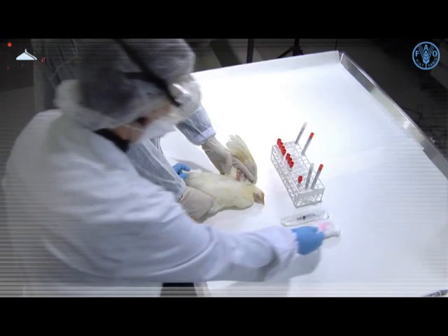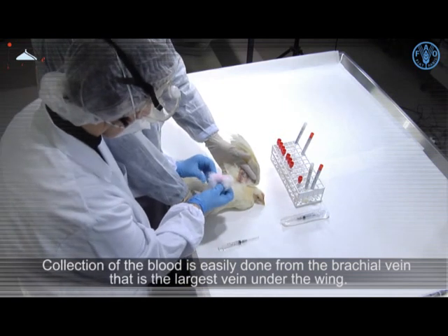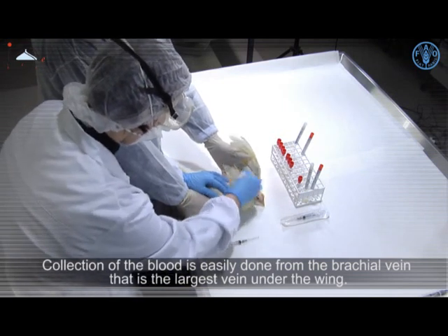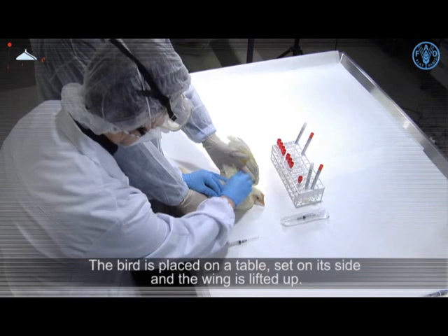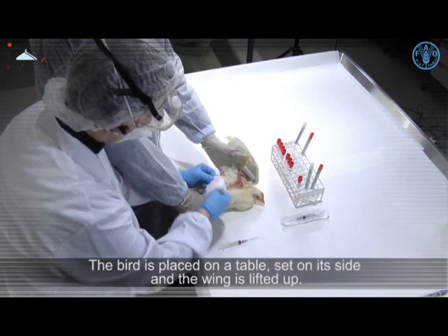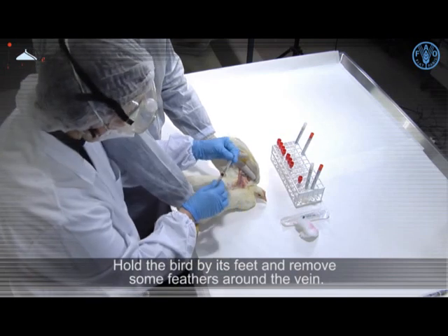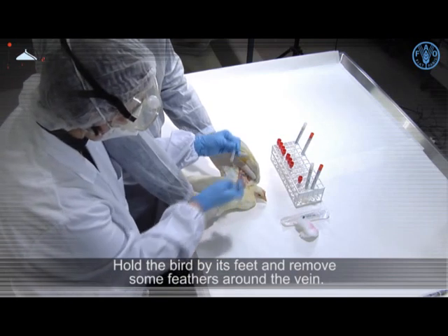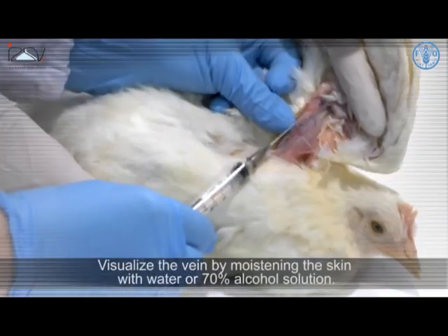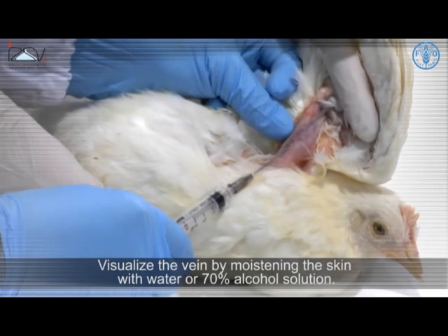Collection of the blood is easily done from the brachial vein, that is the largest vein under the wing. The bird is placed on a table, set on its side and the wing is lifted. Hold the bird by its feet and remove some feathers around the vein. Visualise the vein by moistening the skin with water or 70% alcohol solution.